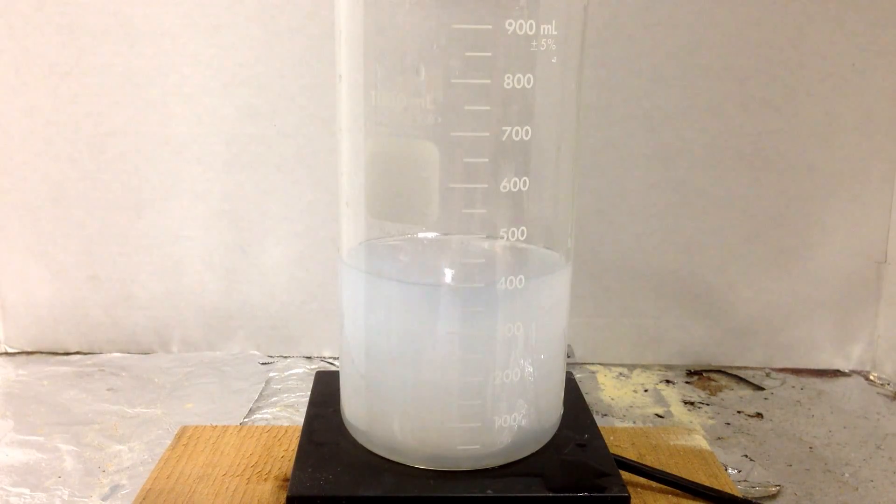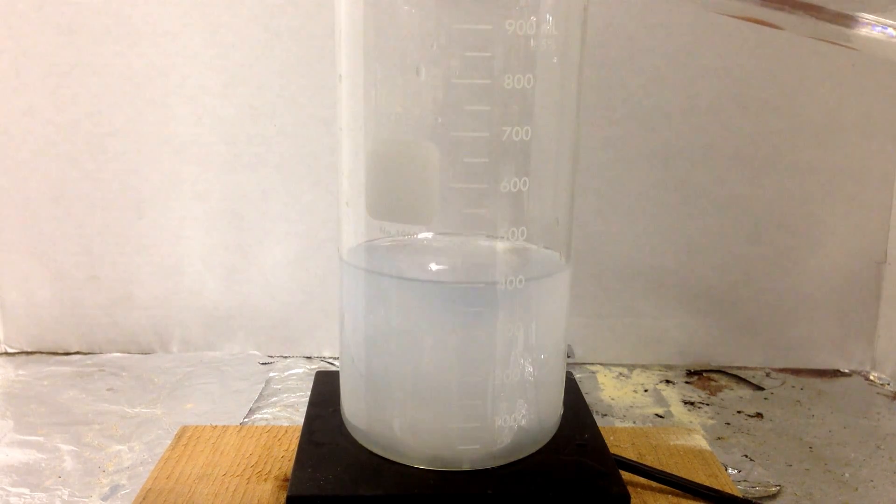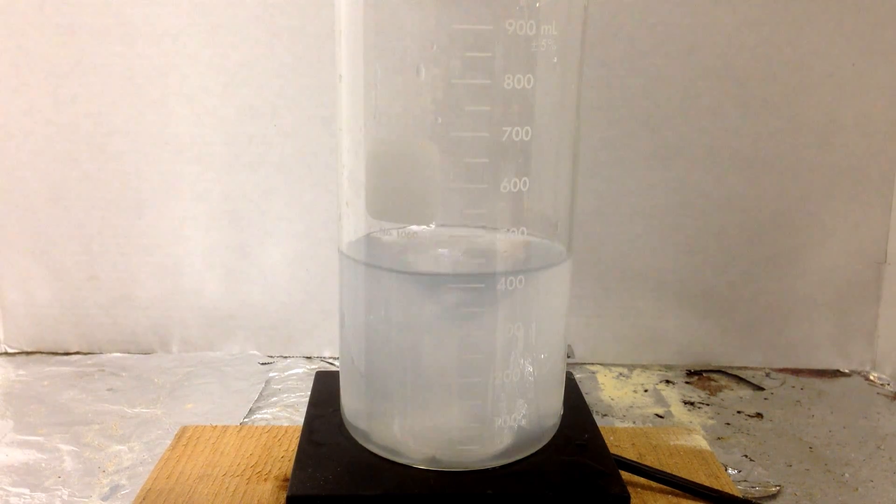It's a weak base, an insoluble base, but with a strong acid, like magnesium hydroxide which is usually insoluble, I could try to dissolve this. I should be able to add some acid. As you can see, it should dissolve it. We're getting a little clearer. Why did it get dissolved?